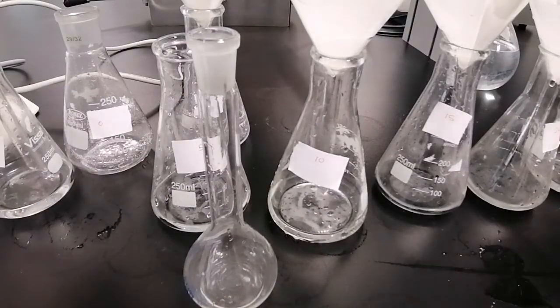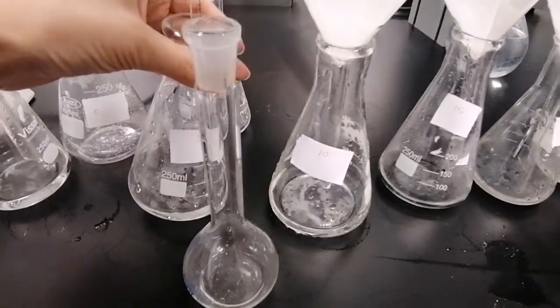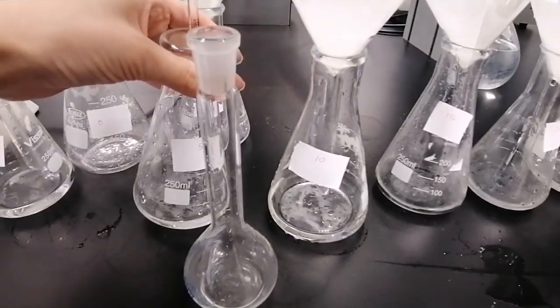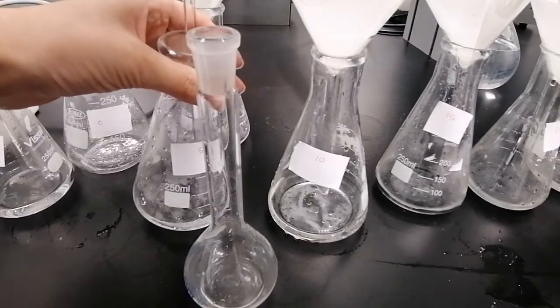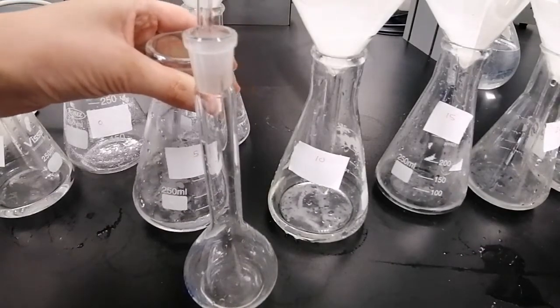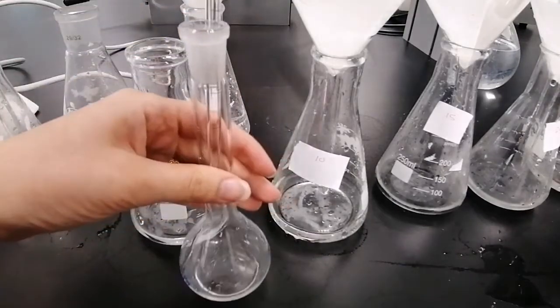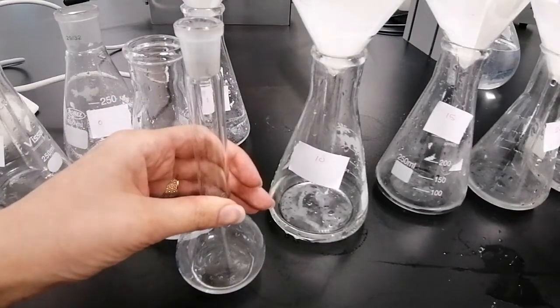Okay, here's from 5. As I said, we don't need a calibration curve here. We'll use the same absorptivity value we calculated in the previous part in the pH method. The same will be applied as long as we are working at the same lambda, which is 287 nanometers.